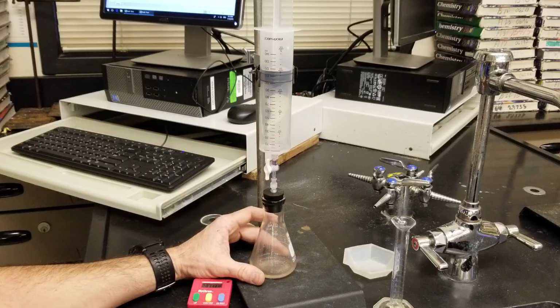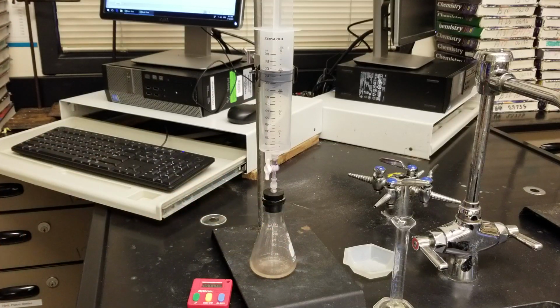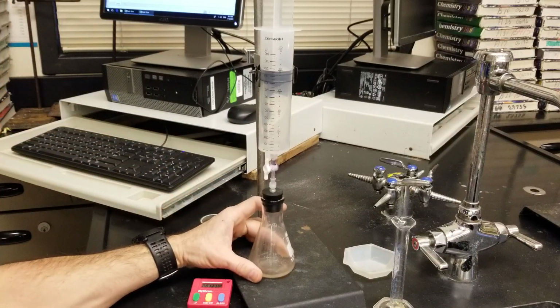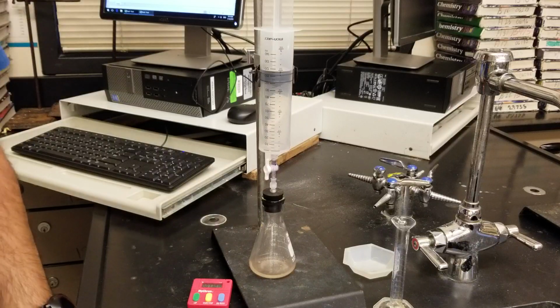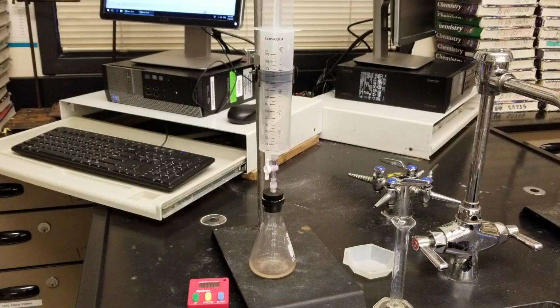So we have a really strong initial rate for the first 6 minutes, and then it looks like our reaction stalls out completely. And at this point, if you want to call it, instead of sitting around and watching it for another 3 minutes, then, because I'm at 7 minutes now, go ahead and stop.